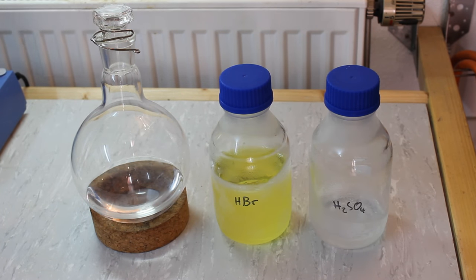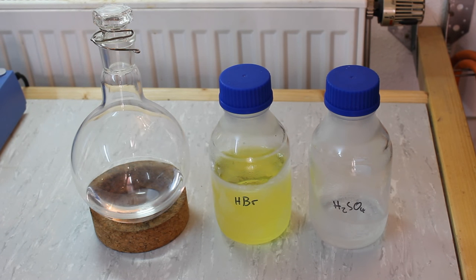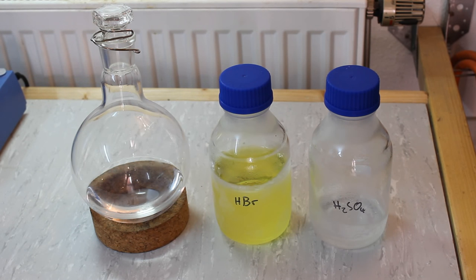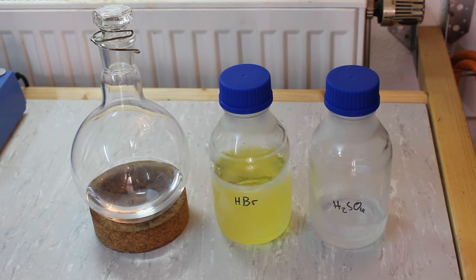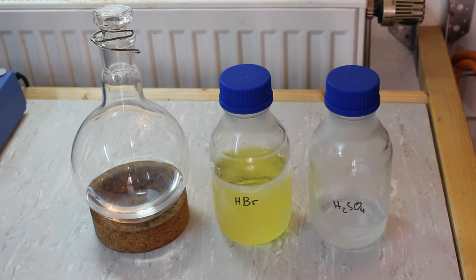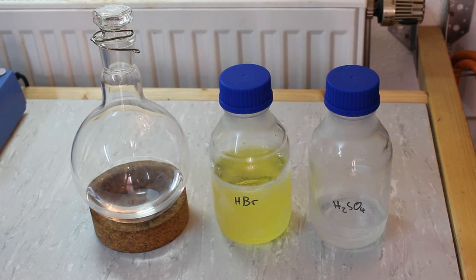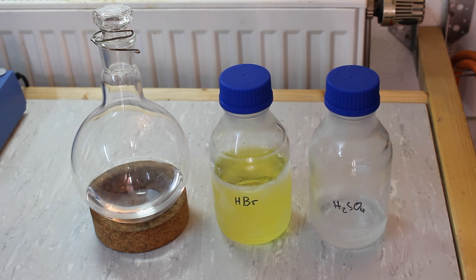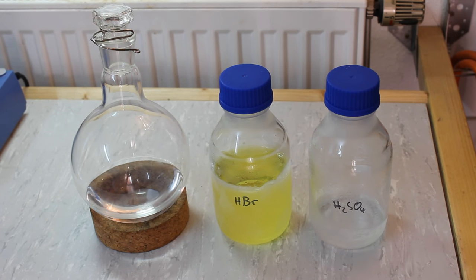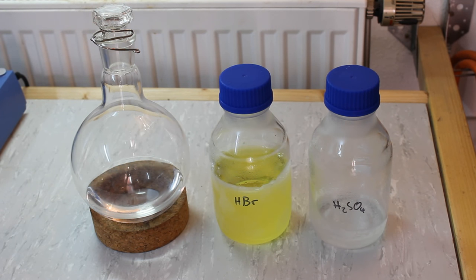You might be wondering why I don't use the hydrobromic acid we made in the last video. Well, I used it all up for tests and it failed so I have to redo this experiment. Since I didn't have any more and didn't feel like making more, I'm using commercial hydrobromic acid. This has been sitting on the shelf for quite a while so it has taken on a slightly yellow color, which I suspect is elemental bromine. So I'm going to add a spatula of red phosphorus and then put the hydrobromic acid and the sulfuric acid back in the freezer to pre-cool them for our experiment.